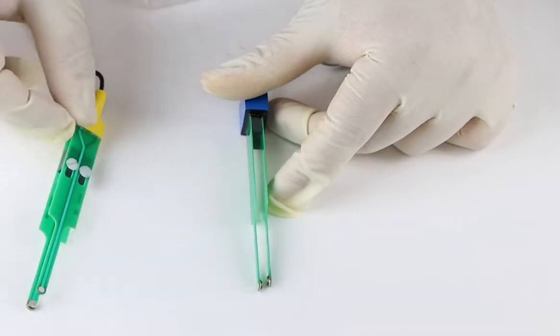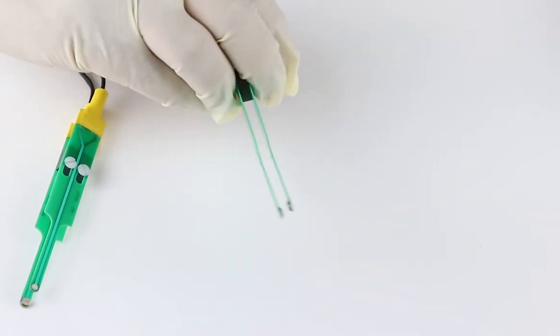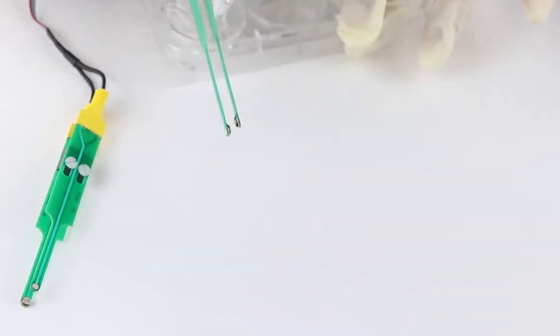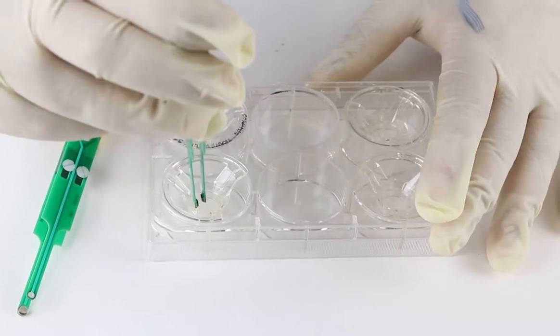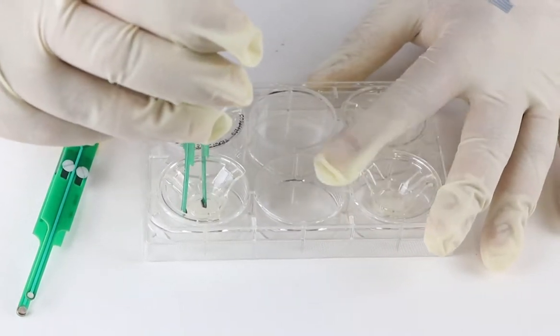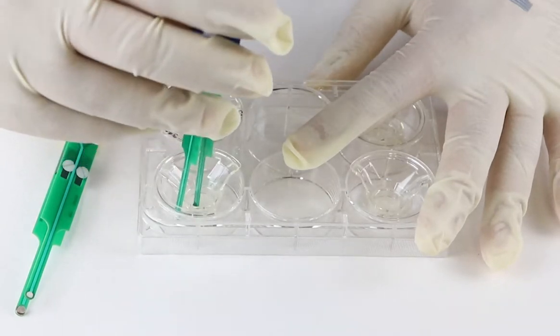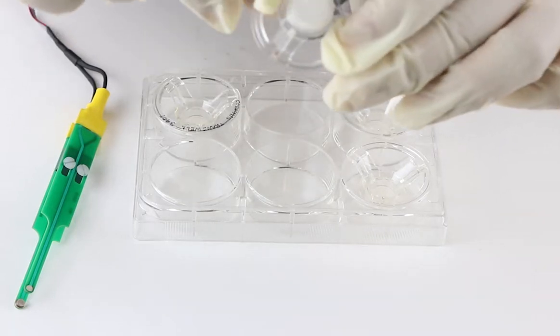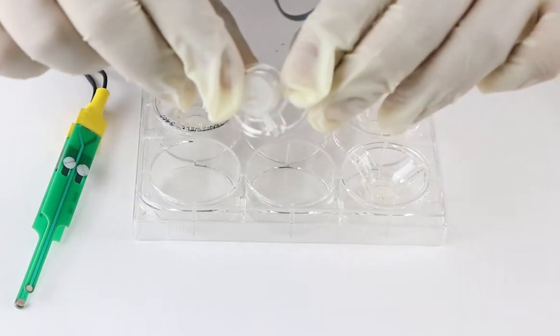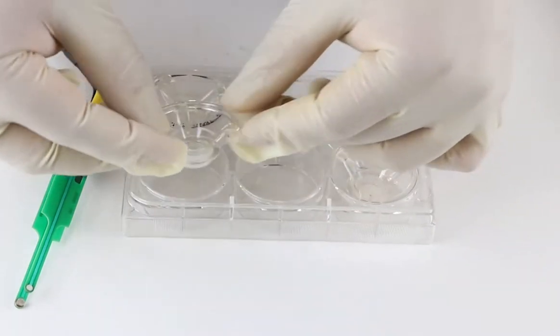The depth of Snapwell inserts, for example the Corning 3407 insert, is such that the short leg of the STX2 electrode can touch the membrane and can damage the cells grown on top of these inserts. With Snapwell inserts, users are advised to use the STX3 electrode.